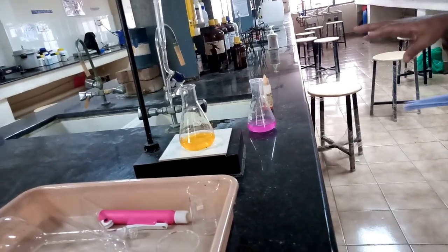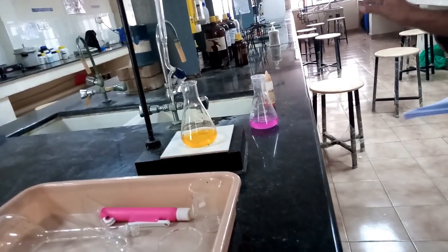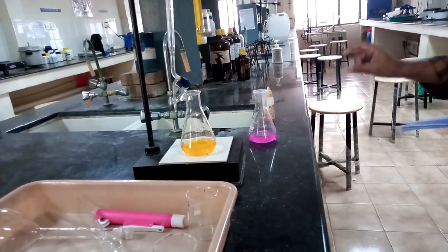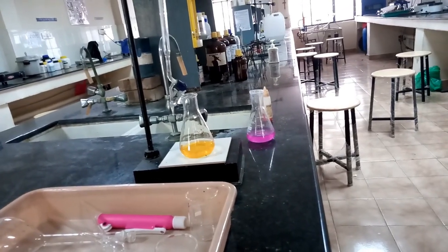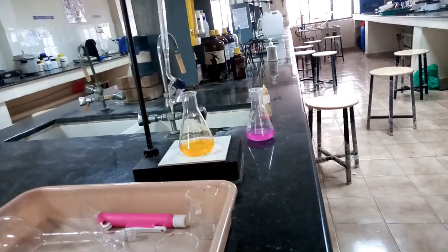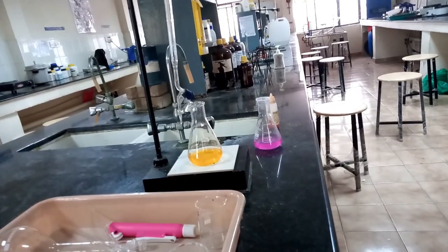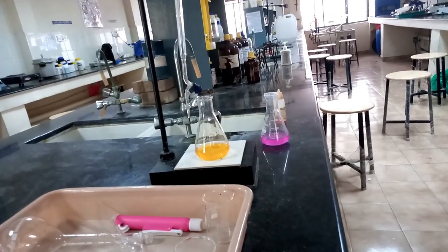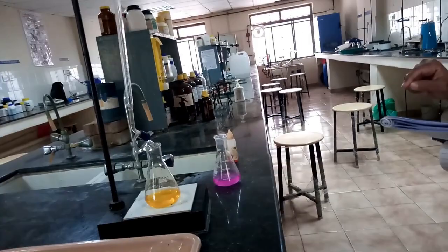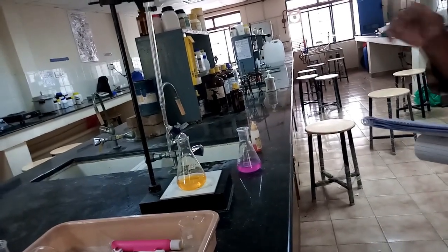Here you have to conduct three sets of experiments: one for the tap water, another for the drinking water, and the wastewater sample. You take 20 ml or 50 ml of the wastewater sample, and then add the phenolphthalein indicator. If there is no color change with the phenolphthalein indicator, then we call it phenolphthalein alkalinity is 0. Then you have to add the methyl orange.